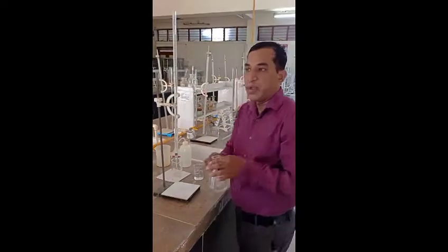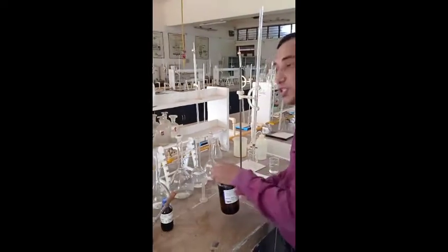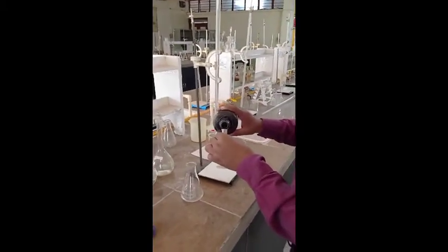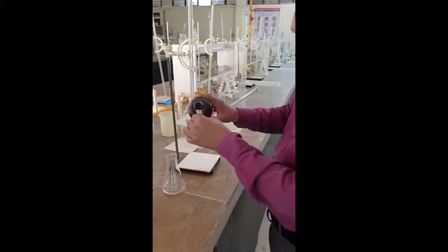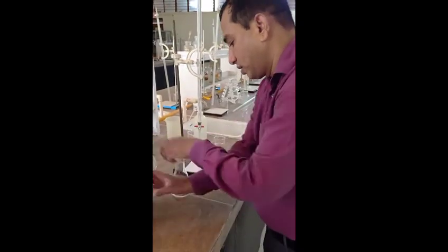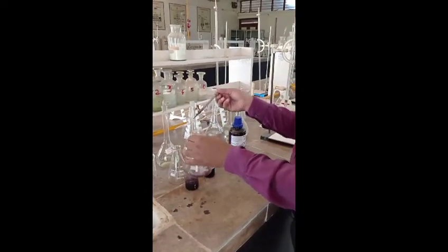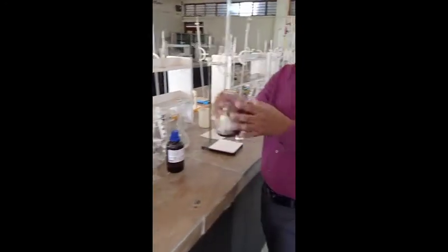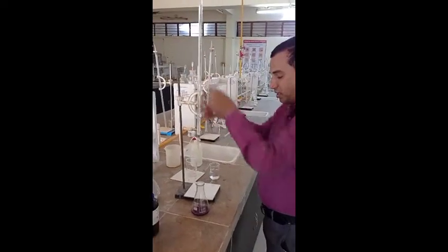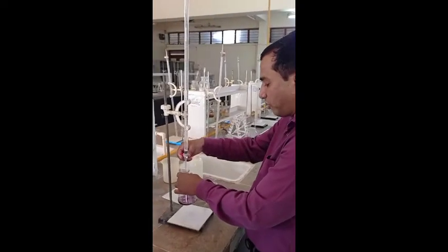We pipette out 25 ml water sample into a conical flask, then we add 10 ml buffer, since it is a complexometric titration. Then we add EBT indicator. The solution becomes a wine red color. Then we titrate this with EDTA until the color changes from wine red to blue, adding drop by drop.